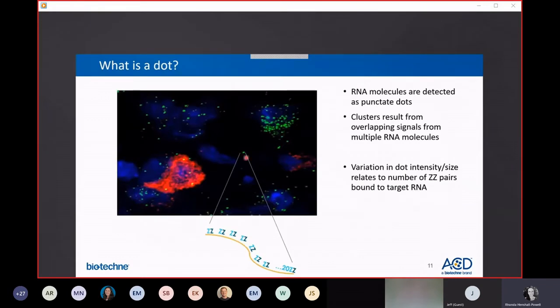So dots, at the end of the day, is what you're looking at under the microscope. For quantification, we really don't care about dot size or dot intensity, because the size or intensity of any particular dot just correlates with the number of ZZ pairs that we're able to land on the transcript. So it doesn't tell you anything biologically relevant or interesting to look at the dot size. You're looking for dot number if you're quantifying.